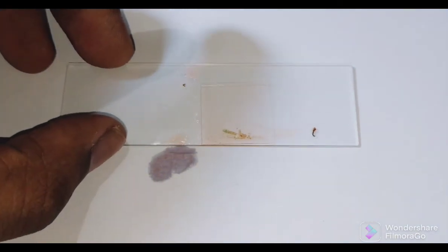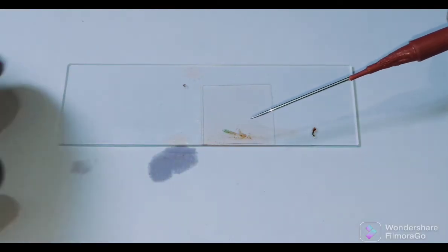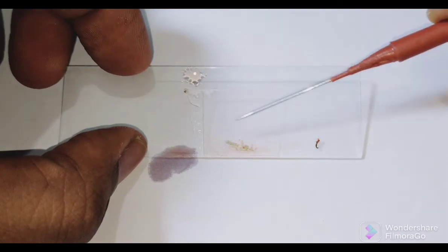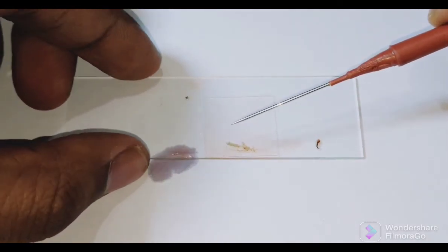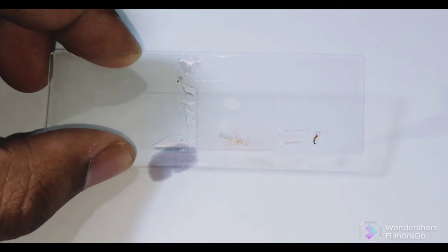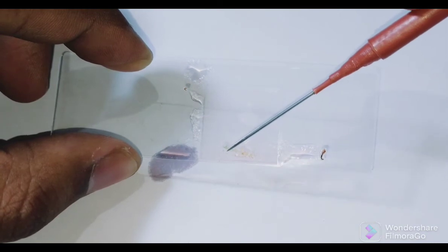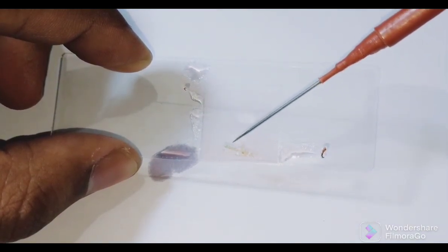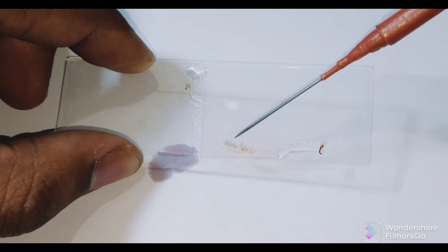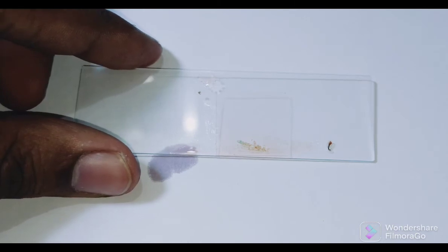I pressed it with the help of the pencil. I hope you understood how to do it. The salivary gland is exposed in a small amount. You can see it better under the microscope. I will show you a photo under the microscope of how it appears.